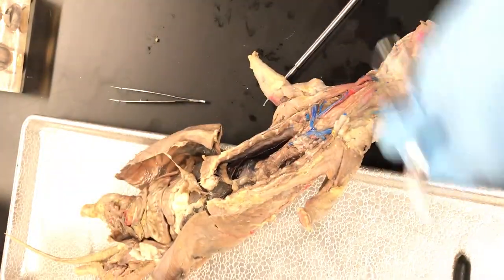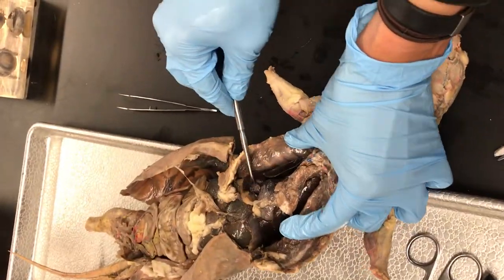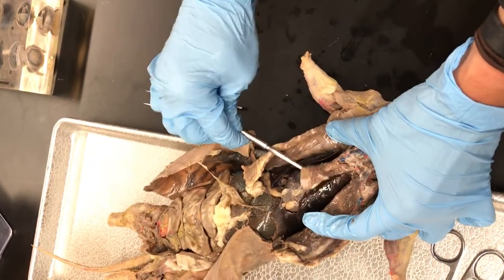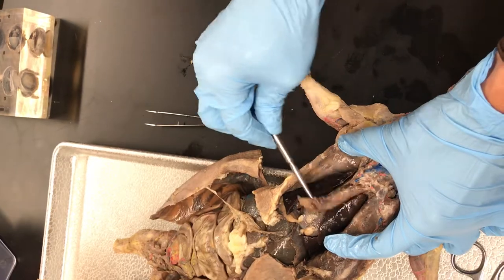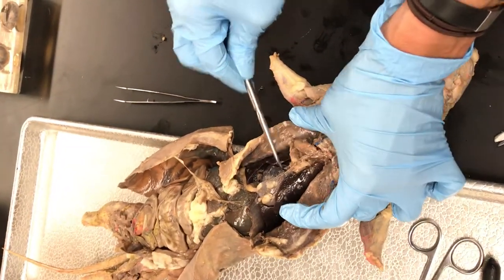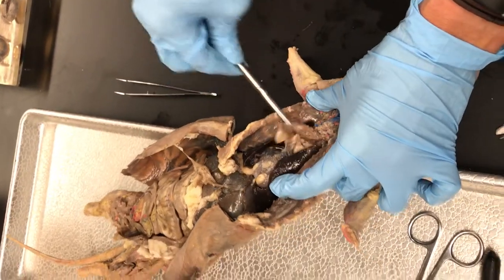So now, these dark things - those are the lungs. There's the heart. This organ here is the thymus. Younger minks have a larger thymus - that's where the T lymphocytes develop. You're going to remove that once you find it, because it's sitting between those cranial lobes of the lungs, and we're going to have to pull that out in order to find our arteries.